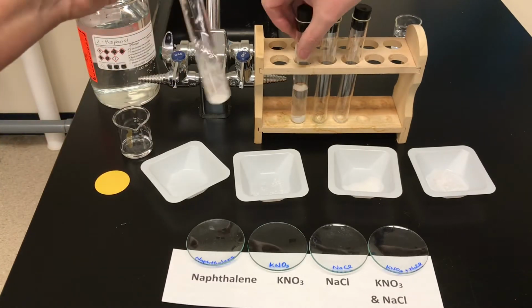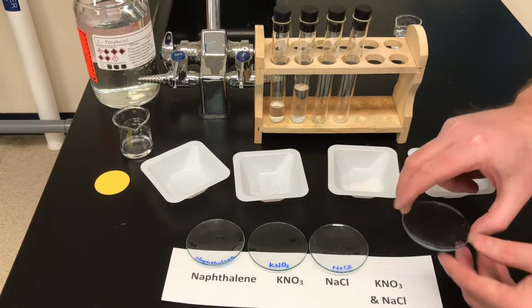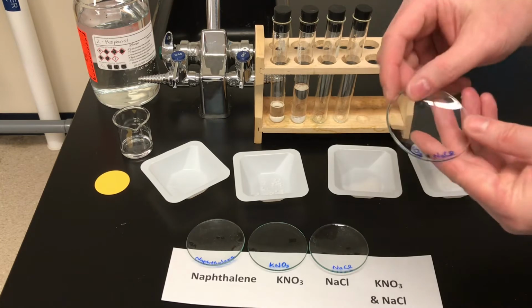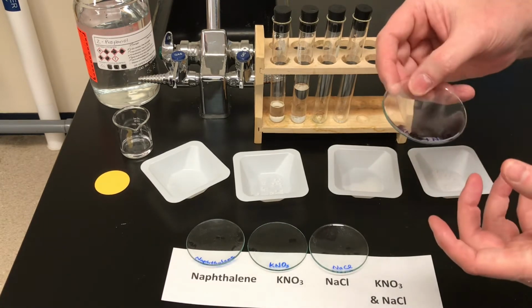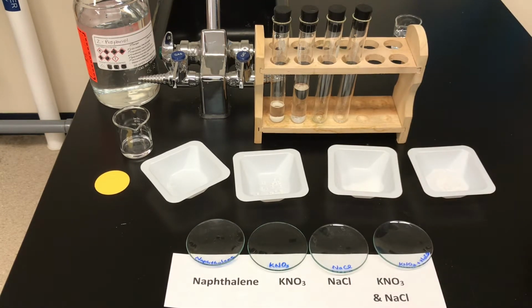Now Ms. Watts just used a term that we may not have heard before, the term watch glass. So a watch glass is just a piece of glass that is shaped like this into a sort of lens shape. It's concave, and I've written on this one in Sharpie potassium nitrate and sodium chloride, and we've labeled them all. So make sure you know the name of this piece of lab equipment, a watch glass. It's named that way because we're going to watch the crystals form on the glass and examine them once the liquid has evaporated. So we're going to pause the video while we create the other solutions, and we'll come back and we'll put them onto the watch glass.